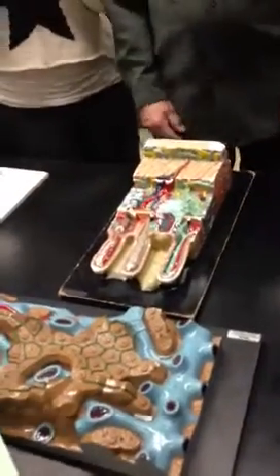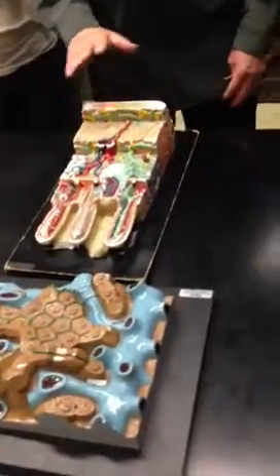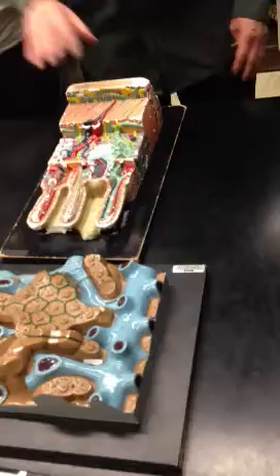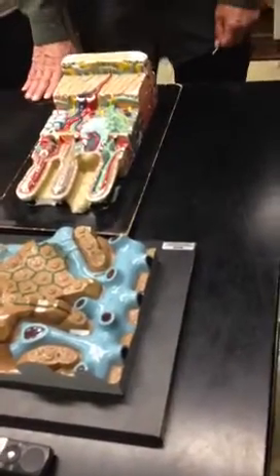All right. This is a microscopic section of the small intestine. Actually, of the jejunum of the small intestine, but that small intestine is good enough for you to know.